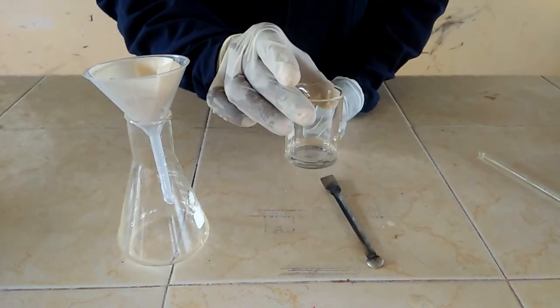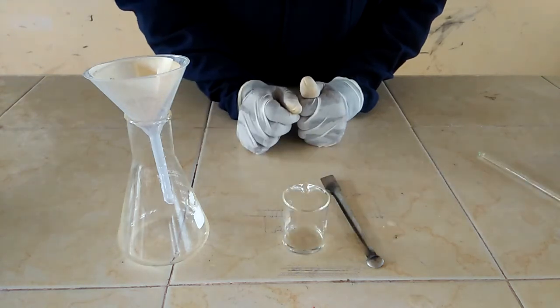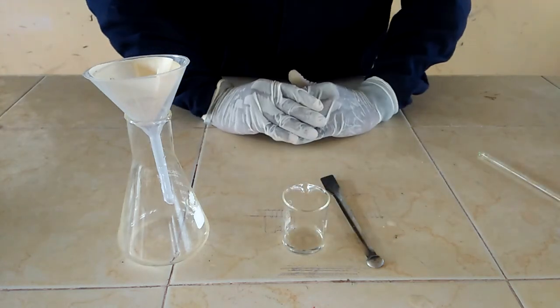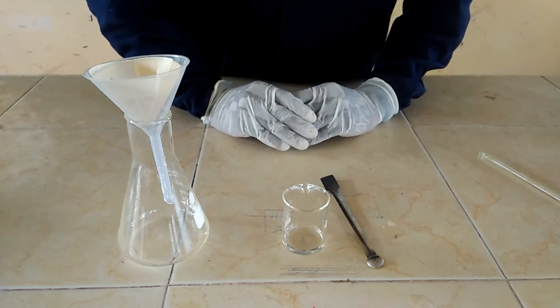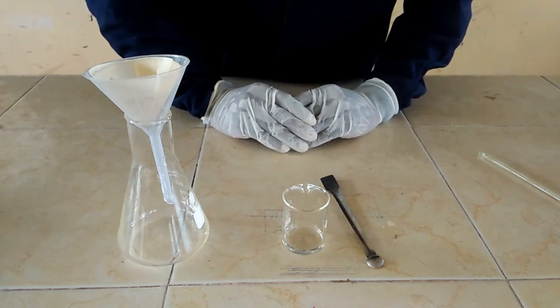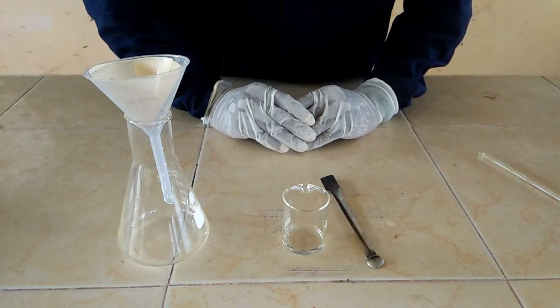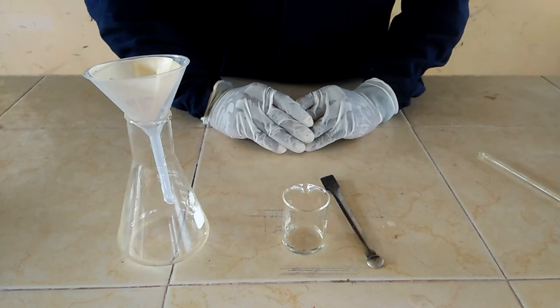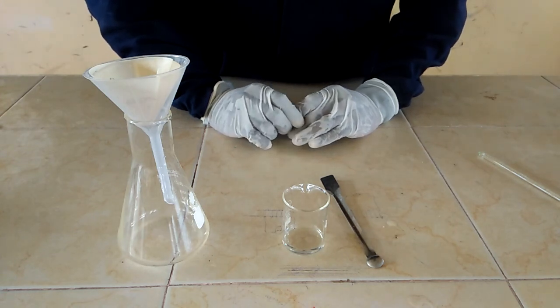Our water is very clean and therefore we can use it for different purposes. This method is great because if you are at home and have fetched some water that is not clean, you can use this to filter your water. We can make what we call a domestic filter using the same principle. Thank you.